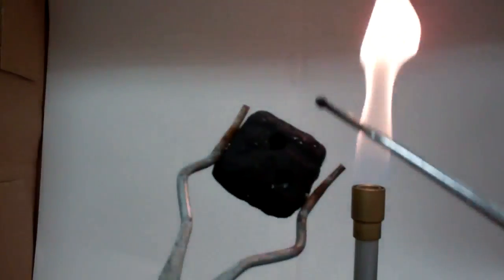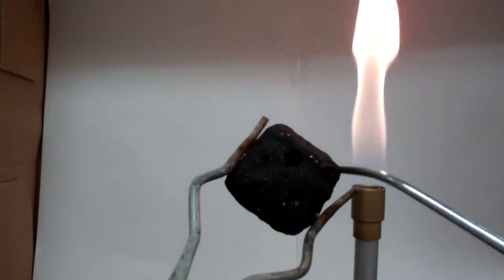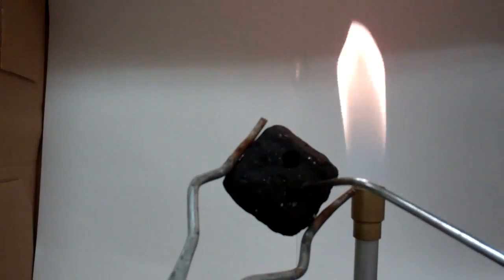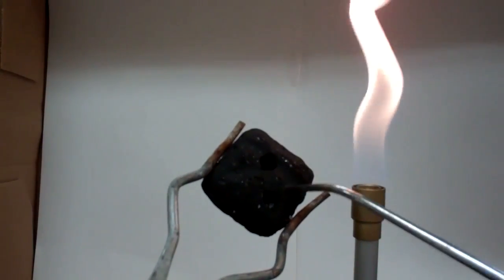So once again, you don't want to blow too hard or too fast because then you're basically just going to blast the entire front of your charcoal. And what you're really trying to do is concentrate that blue jet into just that single hole.